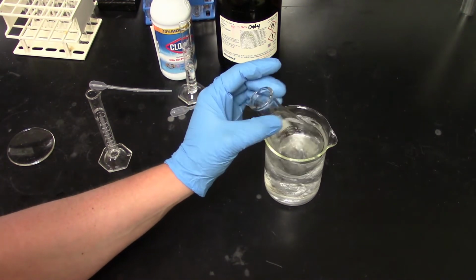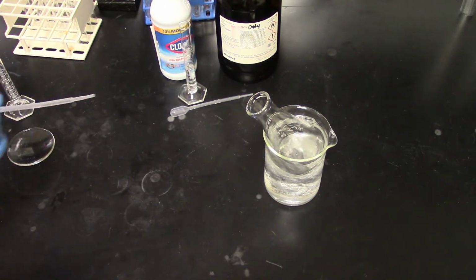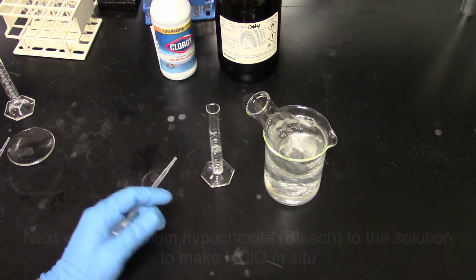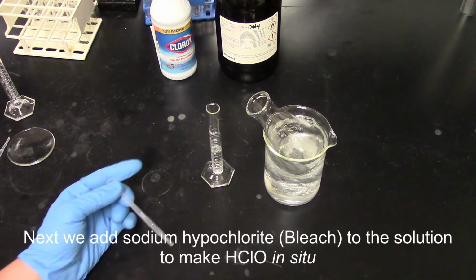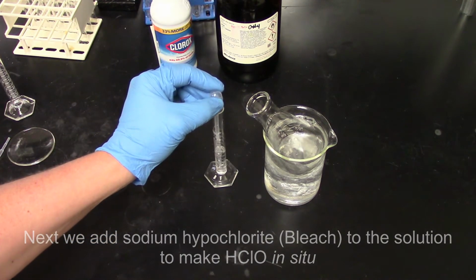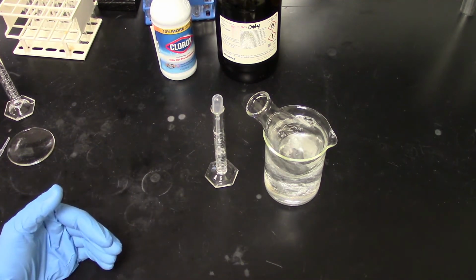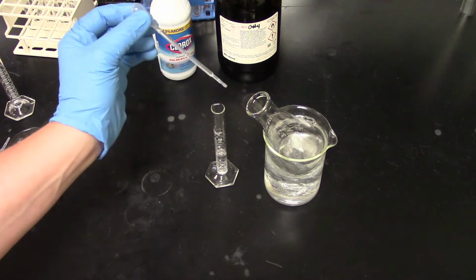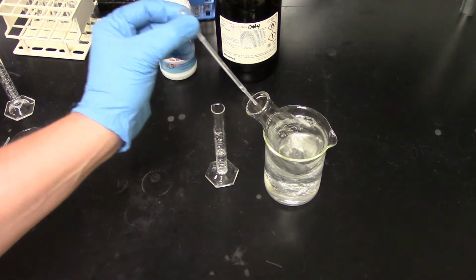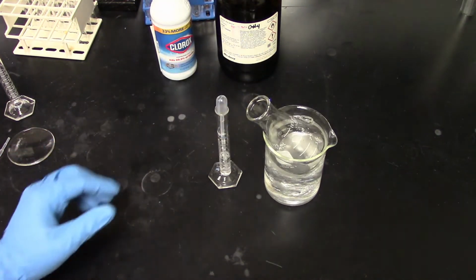Now, once we get this nice and cooled down, we're going to start adding bleach, sodium hypochlorite, to this mixture. What we're doing with this is using glacial acetic acid to form the HClO in situ. The reason we can't add this directly is that HClO just isn't stable on its own on the shelf. So I'm going to start by adding a few drops, and over the next 5 minutes, I'm going to add about a milliliter at a time, and we'll see what it does.